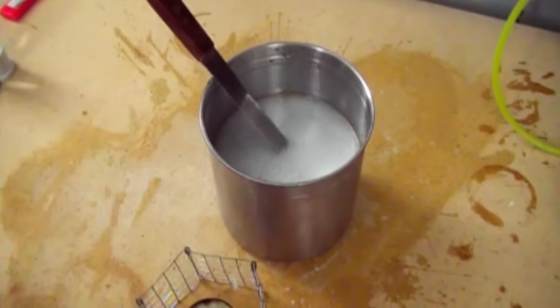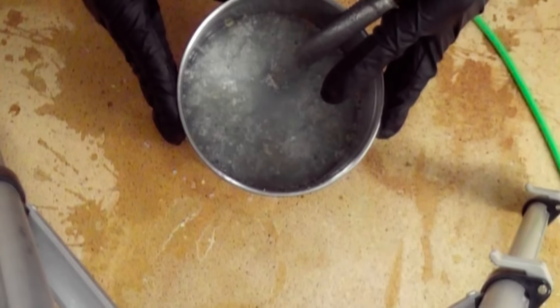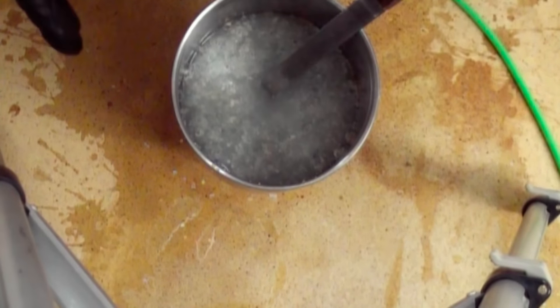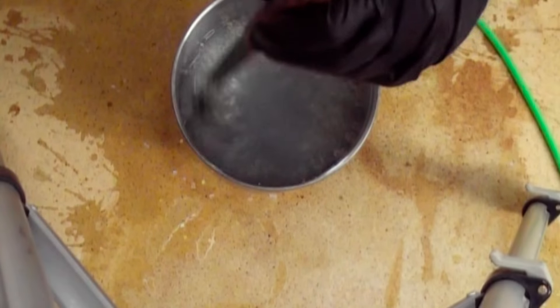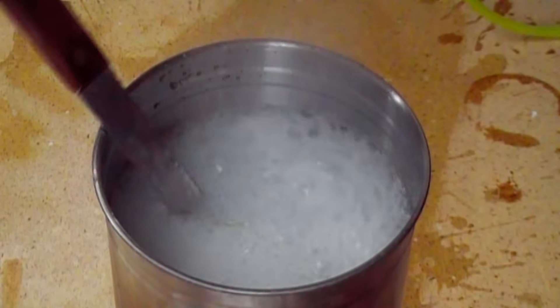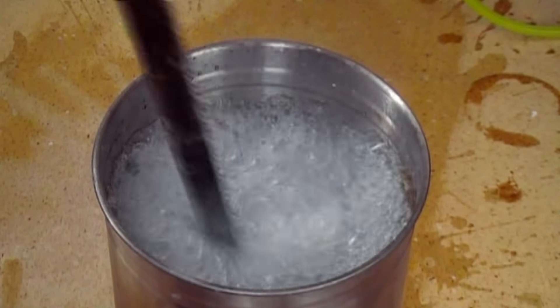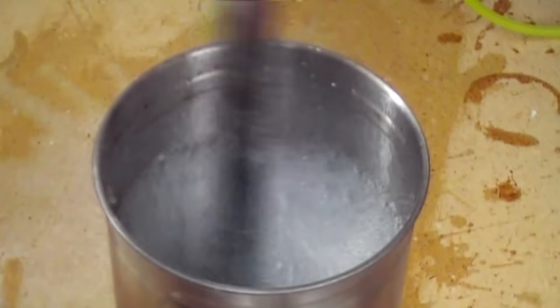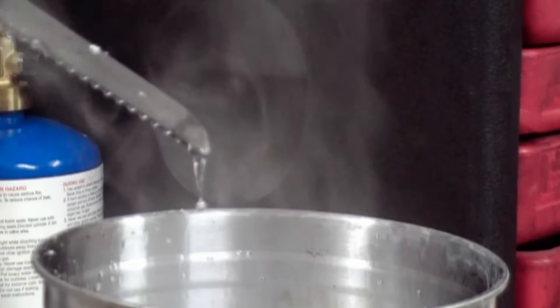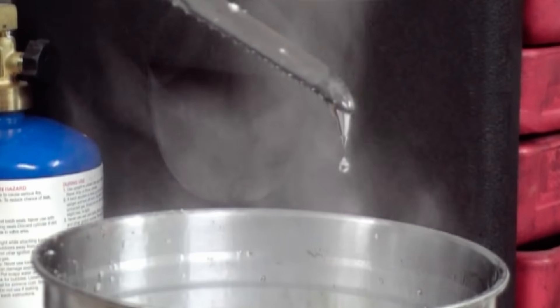After this self-heating is done with, it can be placed back on the heat and boiled to dissolve all of the silica gel. Boil and stir until no more silica gel is stuck to the bottom — it will feel like gravel at the bottom. I continued boiling until the bubbles resembled kind of a syrupy sugar water look, and drops suddenly seize on the end of my stirring knife. That's when I know I'm done.